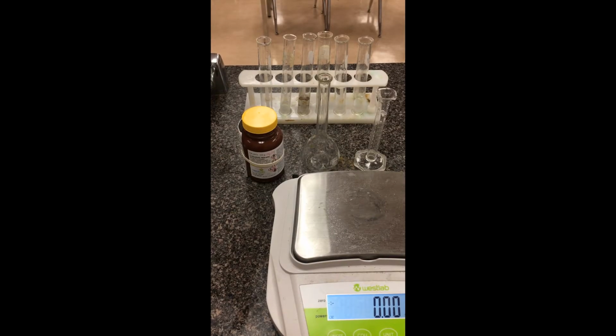Okay, so in this lab, we're going to be creating a stock solution of cobalt-2 nitrate. We're going to perform some dilutions to that. We're going to be running these dilutions through a spectrometer to create what's called a calibration plot, and using that linear relationship, we're going to try to interpolate the concentration of some unknown.